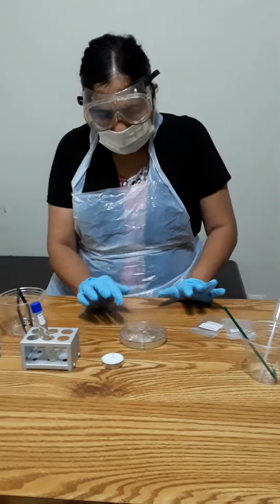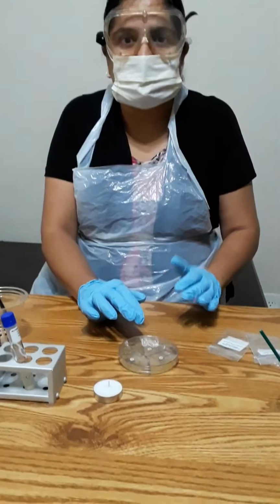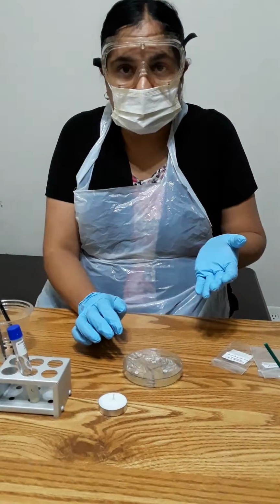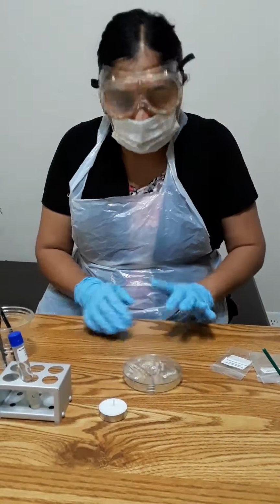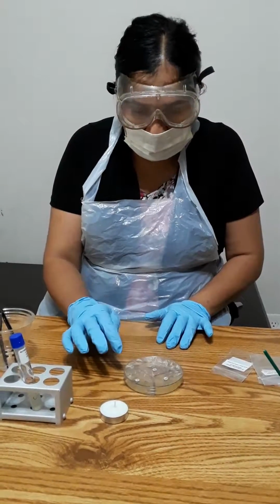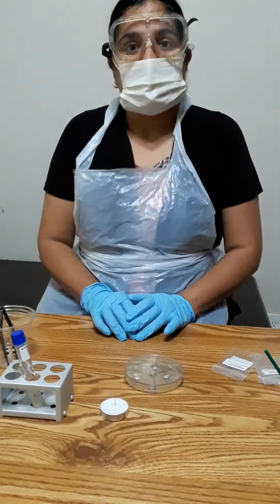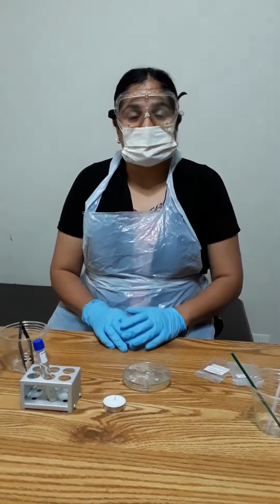So all 3 I have done here, and I'm going to see how each of these antibiotics is going to inhibit the growth of the microorganism, and which one is the strongest and most effective in killing this microbe. After 12 hours, if there is growth, we can see a lawn-like white growth on this agar, and around this disc we will see how much area is without that growth, and measure it in millimeters. Let's wait for 12 hours and then observe the results, and that's it. Thank you very much.